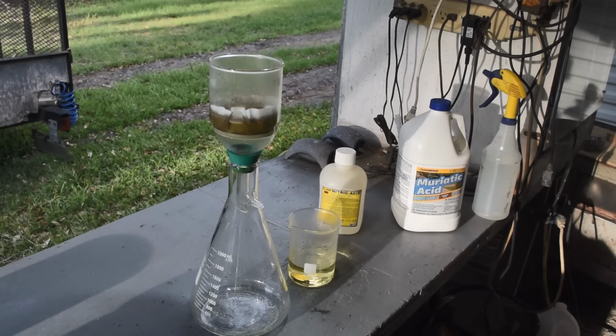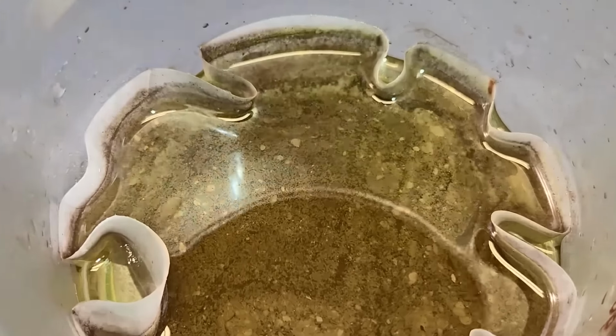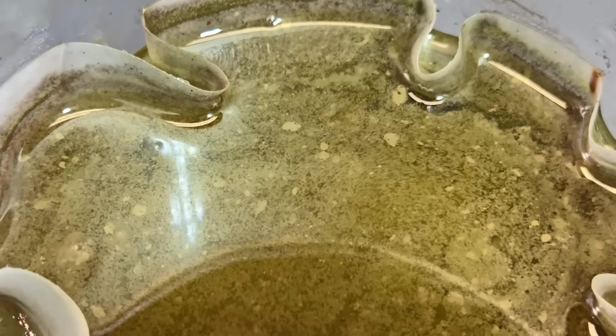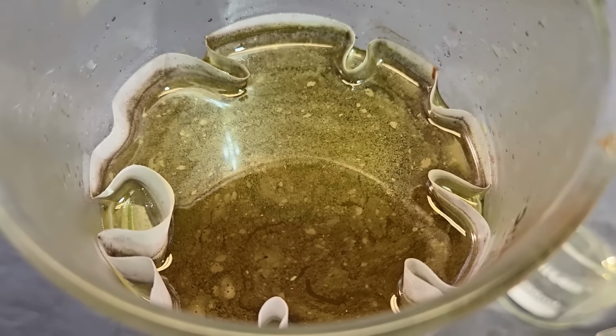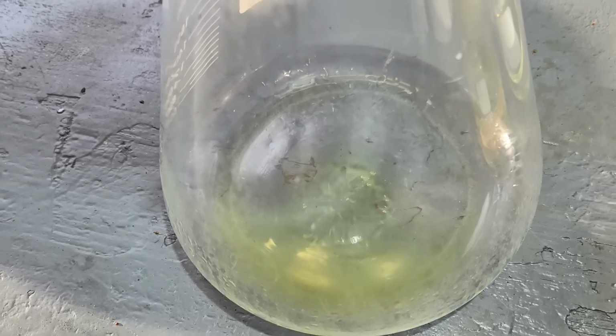We'll just let it go. It's getting late in the day, but I think we got time to get this done before it gets dark. Now, can you see the fizzing and the bubbling in there? Yeah, gold will dissolve even in cold aqua regia. So yeah, it's definitely dissolving. There's a lot of bubbling going on. Alright, so our gold's going into solution and slowly dripping through. Excellent. Everything is going to plan.